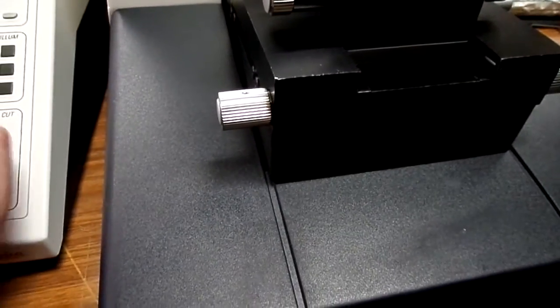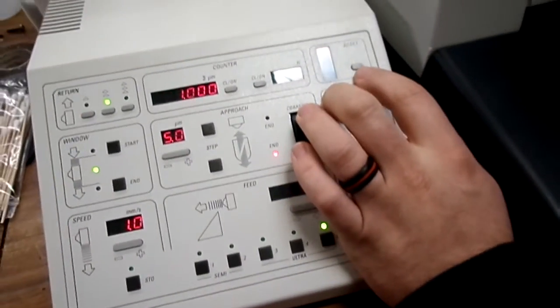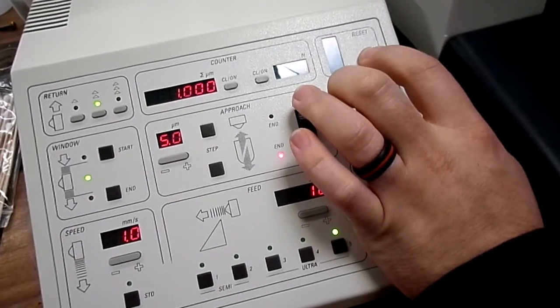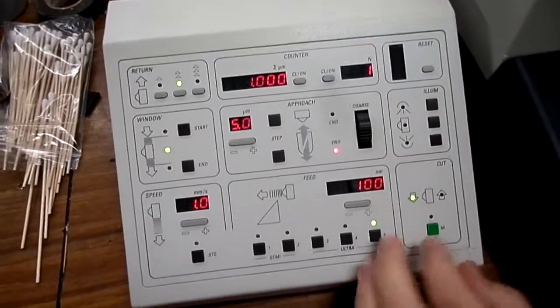And then if you've made cuts, that's the end of the travel. If you've made cuts, you click and hold your reset button, and then it'll retract back to the home position.